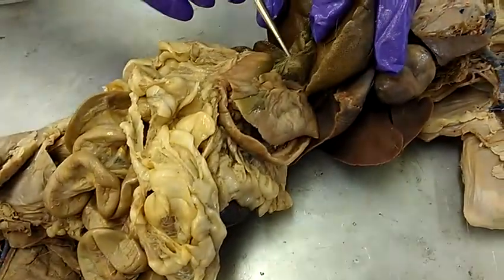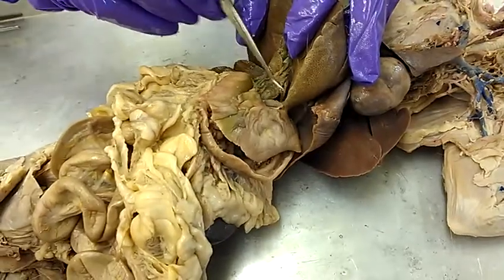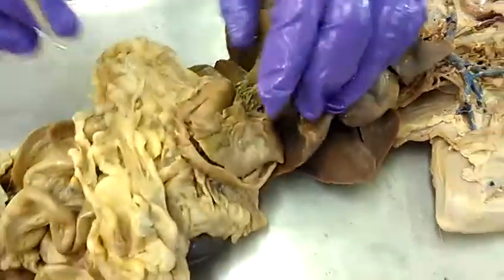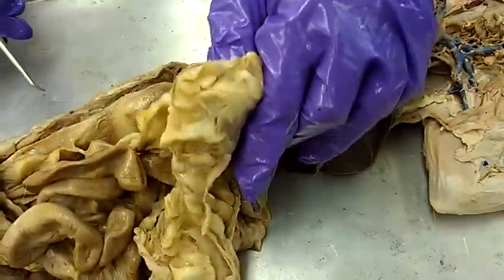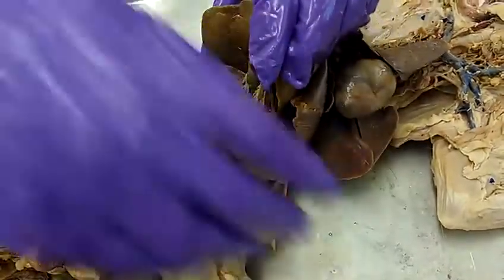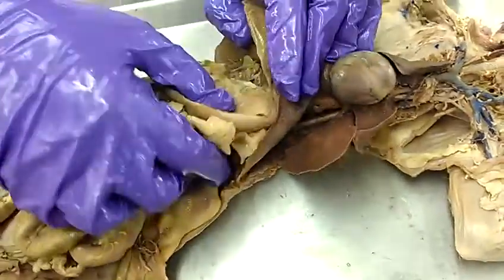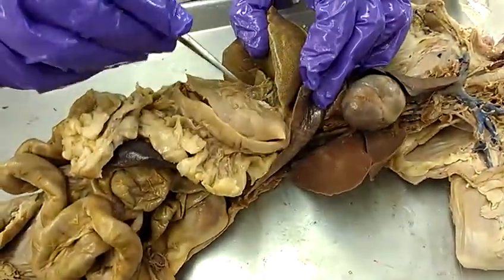Is that the lesser omentum? Yeah. Would you say the lesser omentum comes off of the lesser curvature? Lesser omentum comes off the lesser curvature.